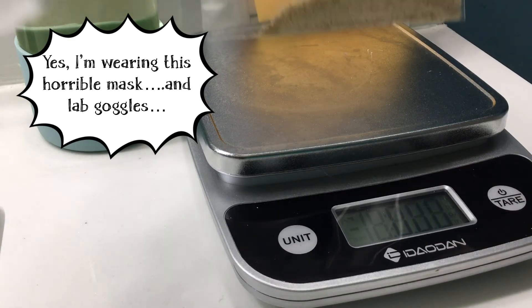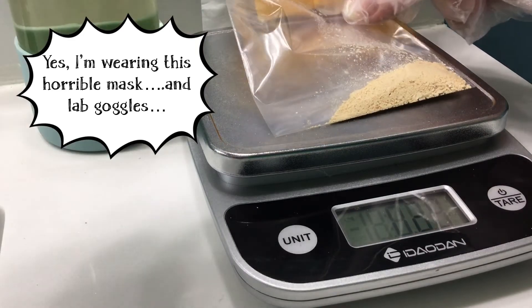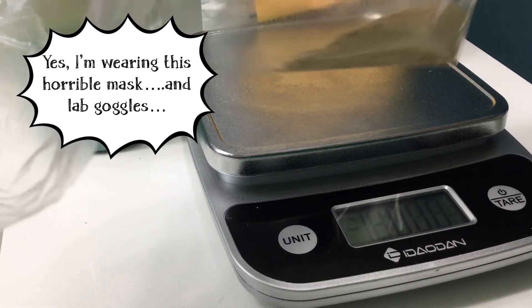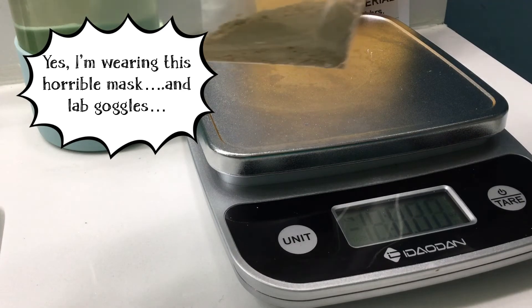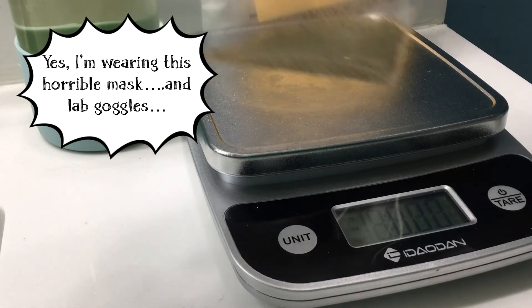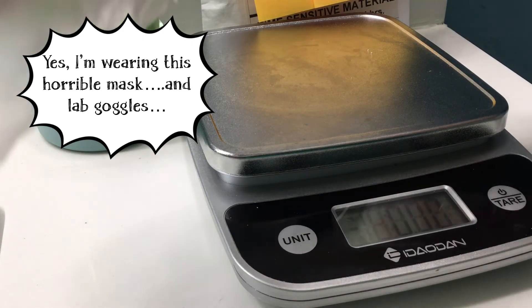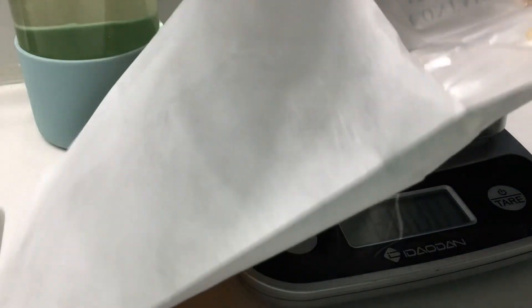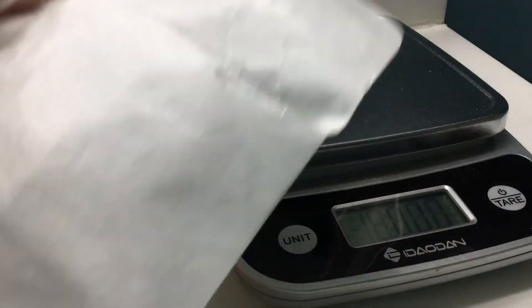My eyes are watering — I'm just really, really nervous. Of course I have an allergy attack while I'm doing this, because Murphy's Law is awesome. There we go — let's get it in the bag. I'm able to seal it.